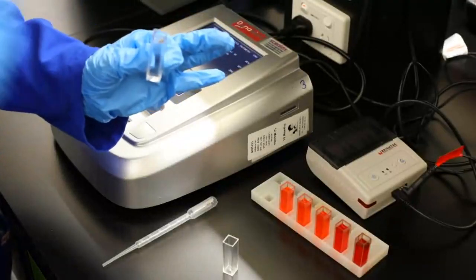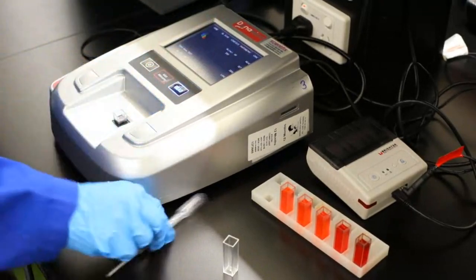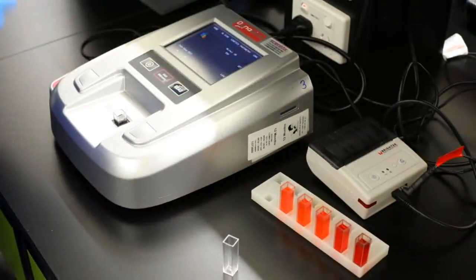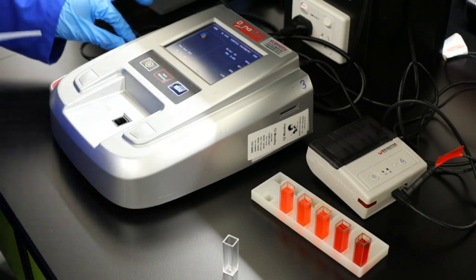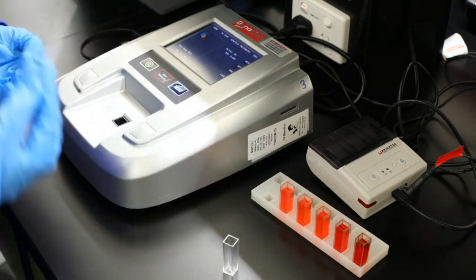So now the first thing, in this case, it's just distilled water. So we're just going to be using our blank. So we simply chuck that in there and we're going to hit our 0. And that gives us our reading, which has background noise in a way, and that's what you're going to be classifying all your colours. In this case, we have 0, and then what you would do is go through each of the different colours and get your different concentration.